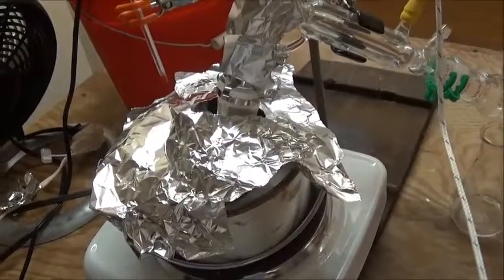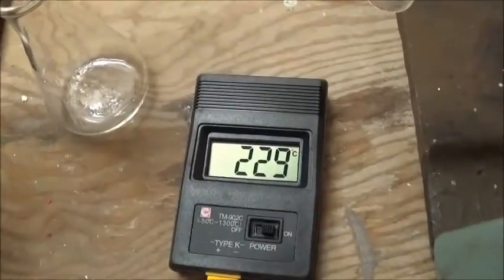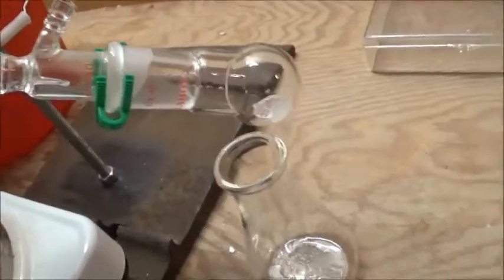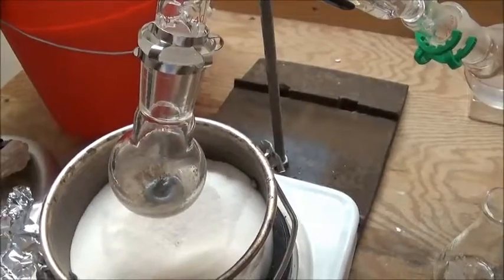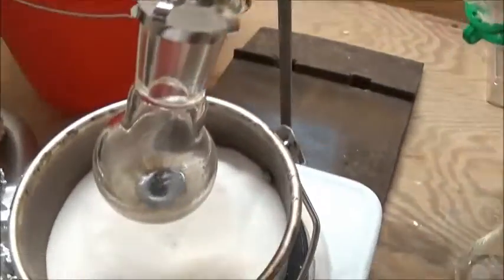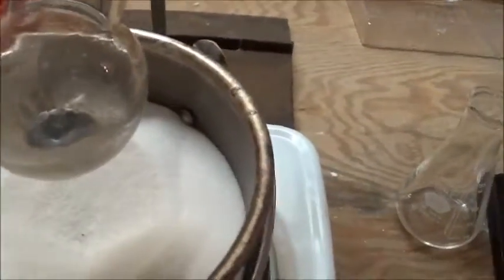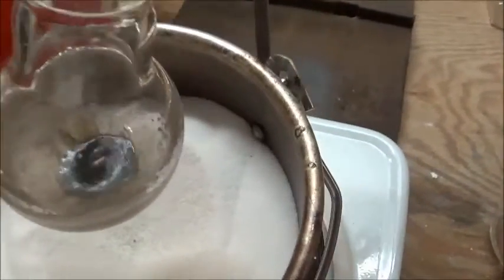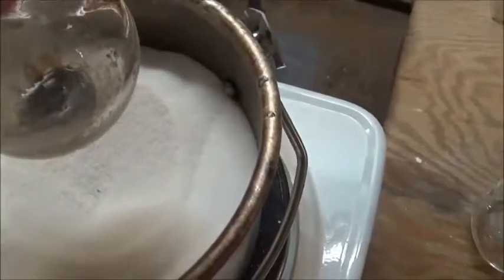After quite a long time of heating and adding aluminum foil insulation, the temperature has jumped up quite a bit and we're collecting a bunch of oil — it looks pretty good so far. The rate of distillation basically just stopped, so I removed the flask from heat. There's just a small amount of brown, viscous, boiling liquid remaining in the flask — it's good we don't have that in our product.